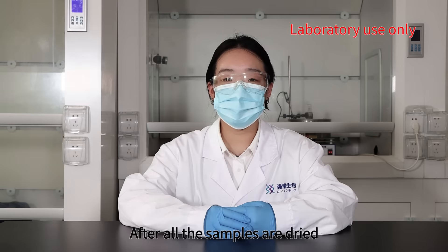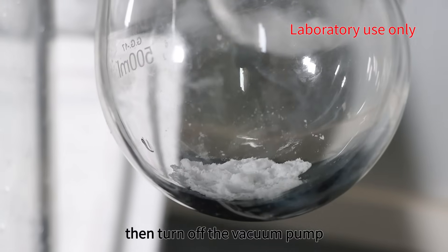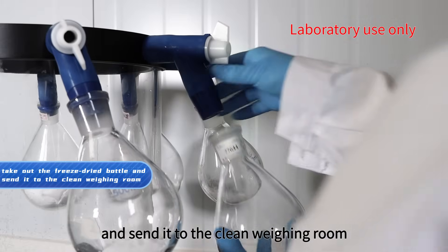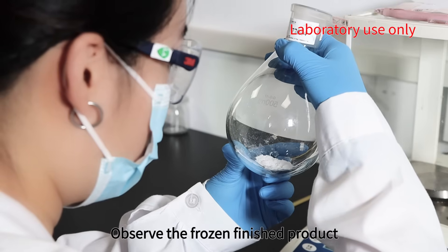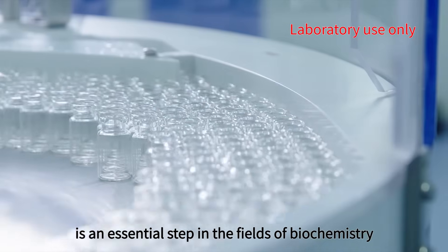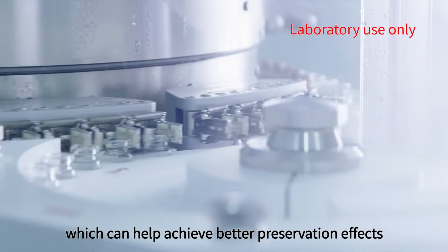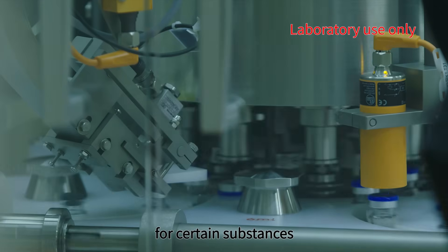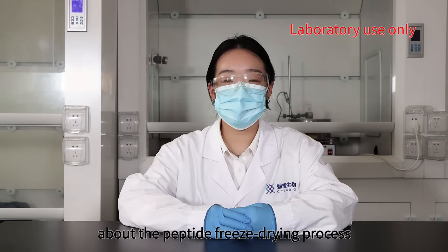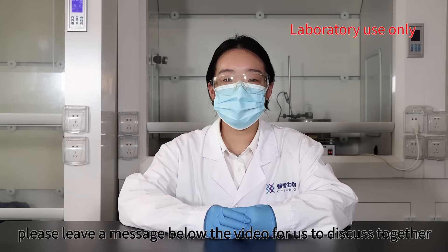After all the samples are dried, open the pressure relief valve first, then turn off the vacuum pump, and promptly take out the freeze-dried bottle and send it to the clean weighing room. Observe the frozen finished product. The freeze-drying process is an essential step in the fields of biochemistry and medicinal chemistry, which can help achieve better preservation effects for certain substances. If you have any other questions about the peptide freeze-drying process, please leave a message below the video for us to discuss together.